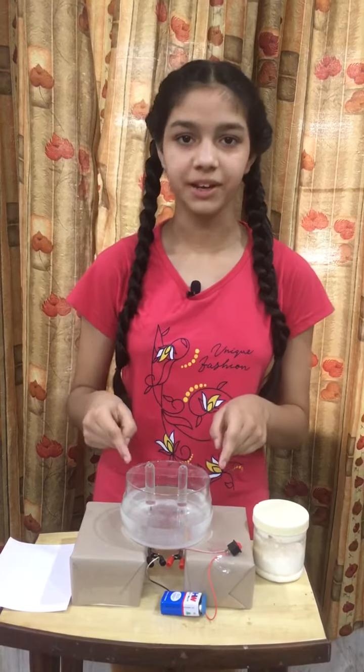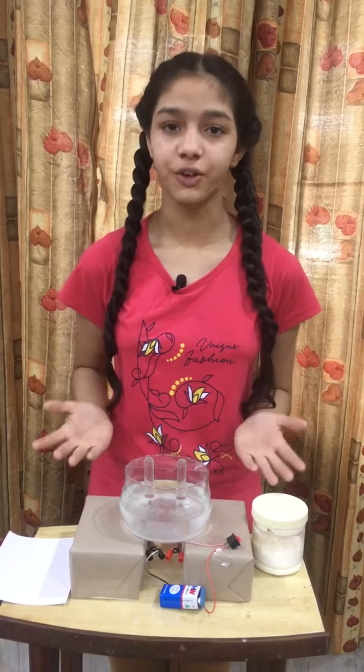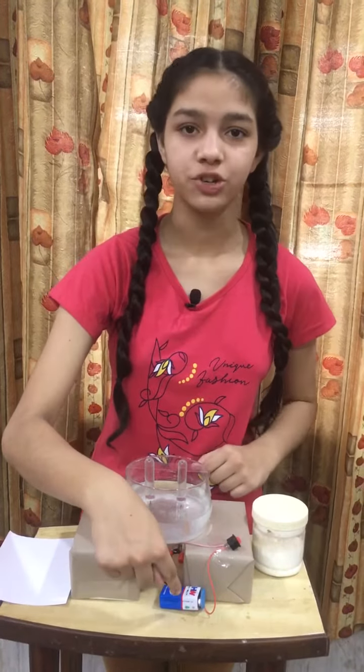For doing this activity, we will require a beaker, two test tubes, two pencils or graphite rods, two wires, a battery, a switch, salt and water.